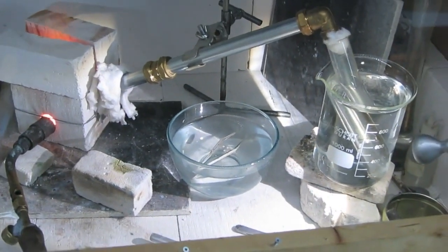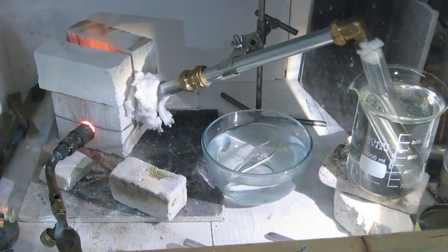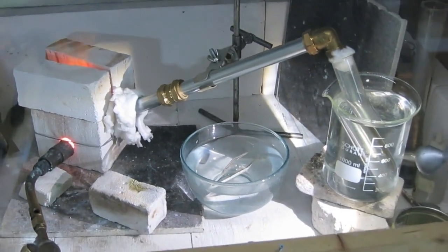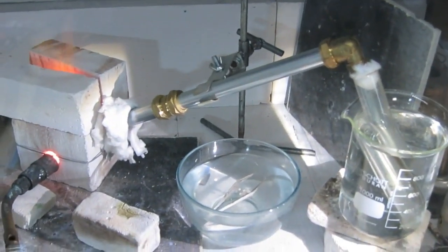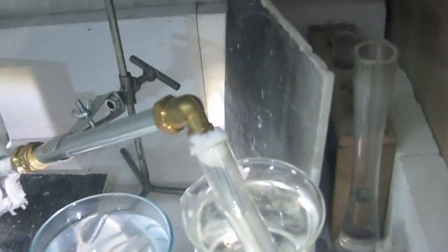Nothing to see yet, but I'm smelling CS2. Smelling CS2, yes, a little bit contaminated CS2, contaminated with H2S or sulfur. It has a very peculiar smell. Look what I smell now. So there is some CS2 formed, but a very tiny amount anyway. The test tube here on the bottom, there is still nothing to be found.